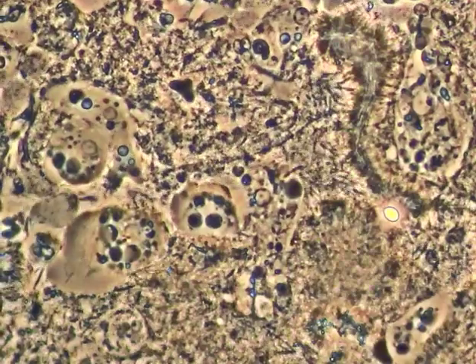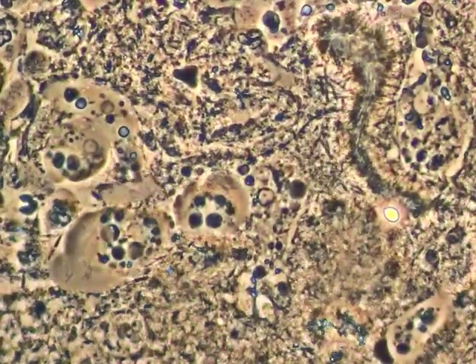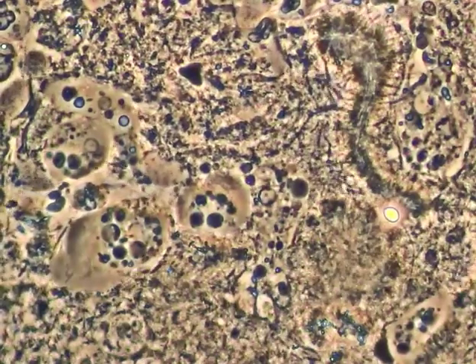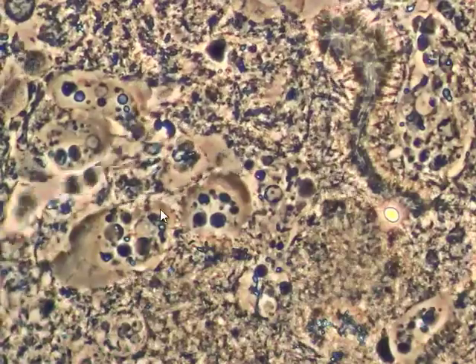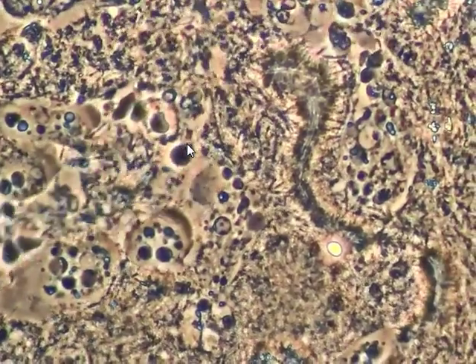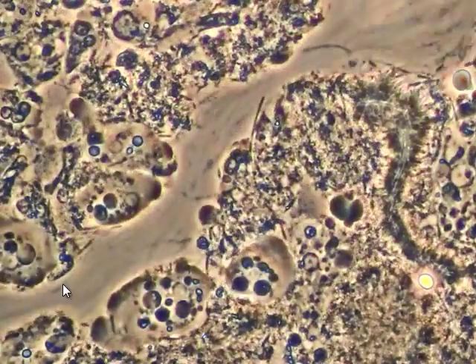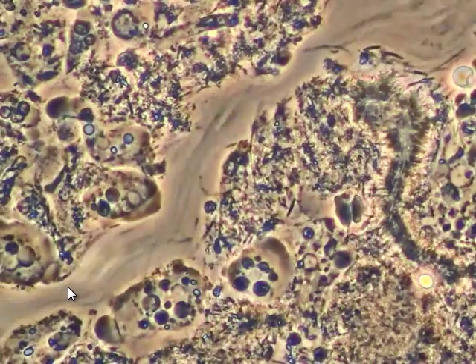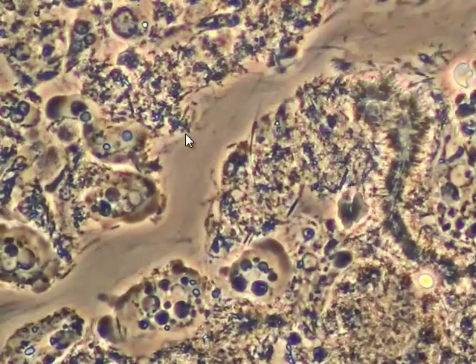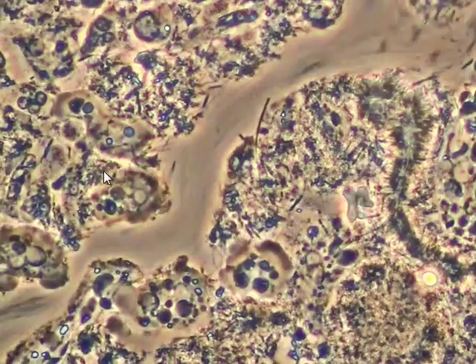This is Dr. Reilly with a sample of bacteria and amoeba. This area here shows a few amoeba, and what I'm doing here is applying a salt solution to this slide. What you'll see is the salt pushing through this area, pushing everything ahead of it until it actually hits this spot where these bacteria and amoeba remain here on the edge.